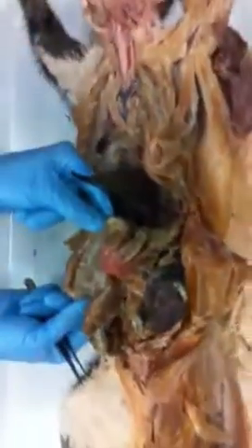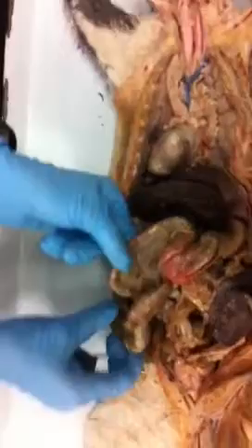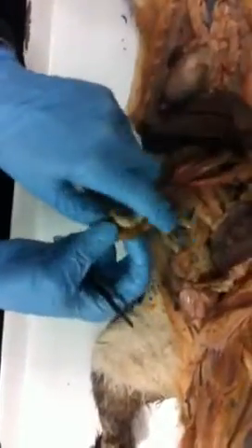That's duodenum. By the time we get to the end of the duodenum, chemical digestion is complete. All of the rest of this really curly part here, this is all jejunum. This is all for absorption. And if we were to take that small intestines and cut it this way and look down into the tube, the inside of the tube is not flat and smooth. The inside of the tube is covered with a whole bunch of little projections called villi.